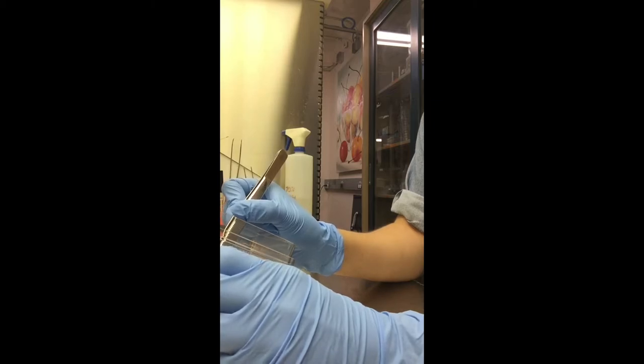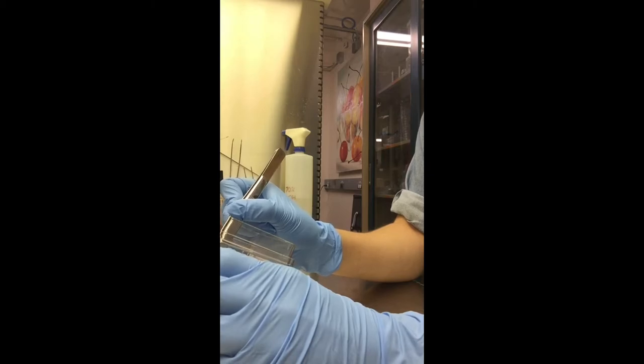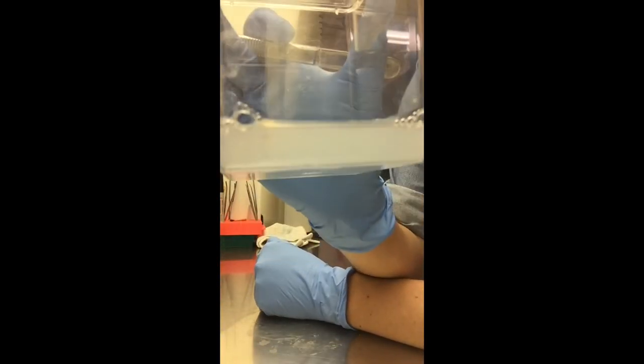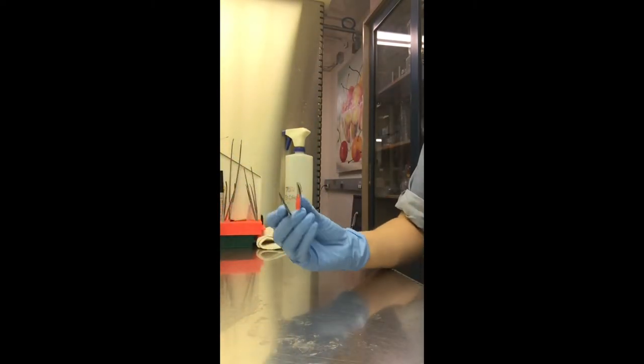And let them very slightly submerged but not completely covered. You can see here, very slightly in the media, not completely covered.